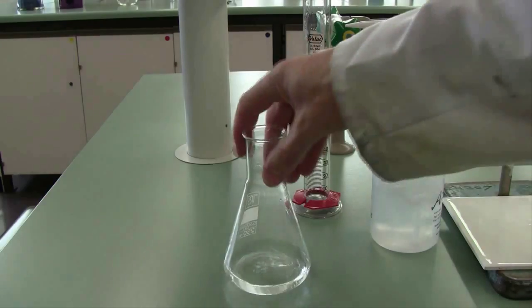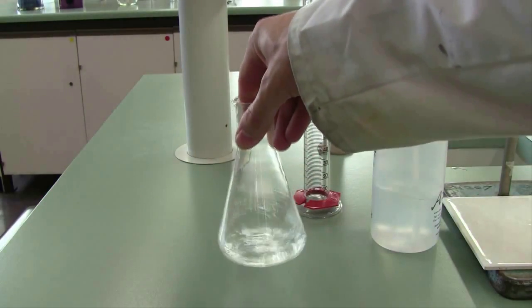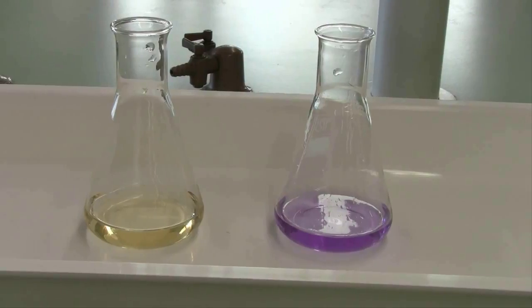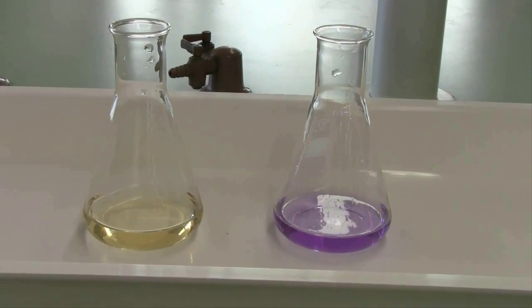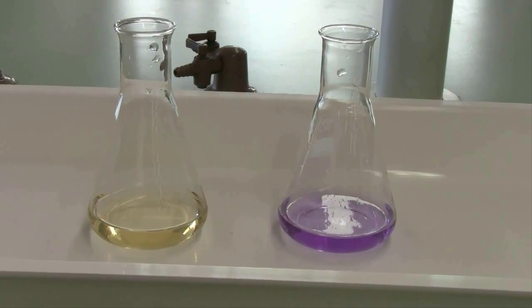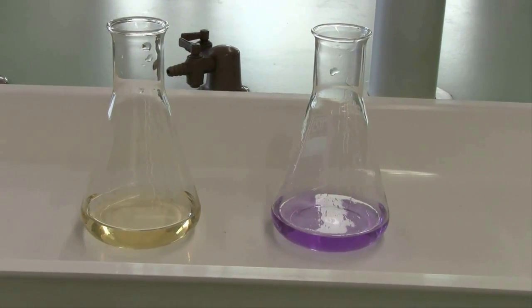You'll then once again be titrating your sample using the same metacresol purple indicator. However, this time the titration will begin with the yellow color and will be complete when you once again reach that permanent purple color in solution that doesn't fade after 10 seconds.